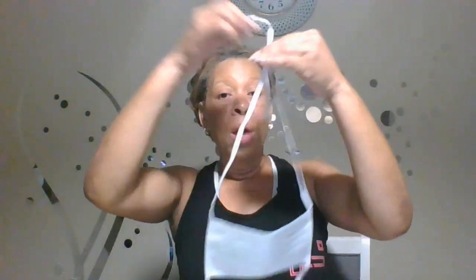So without further ado, let's get started with the mask. You want to make sure it is non-permeable material and that there is a wire at the top that fits over the bridge of your nose so you can shape it and form a good seal. The first thing you want to do is place the mask over your nose. If you have tie straps like I do, the top head strap should go midway up your head.